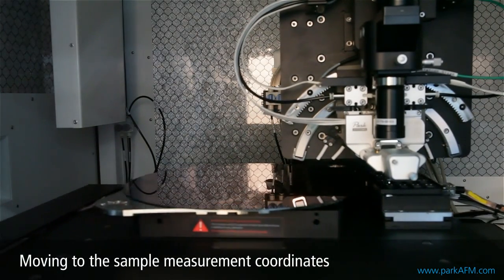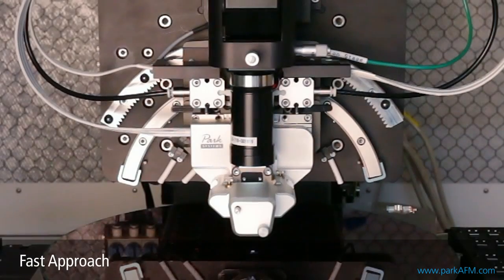Once the tip is ready, it moves to the measurement coordinates and the head rapidly approaches the wafer.